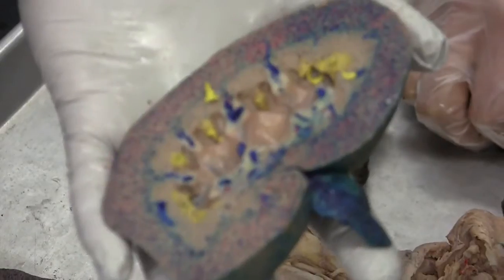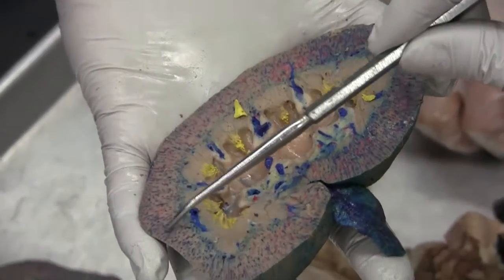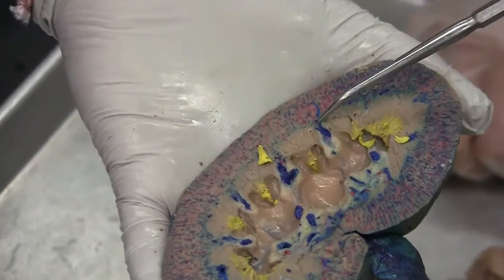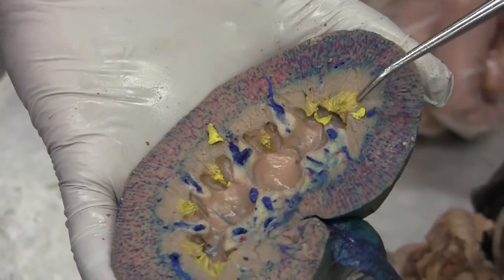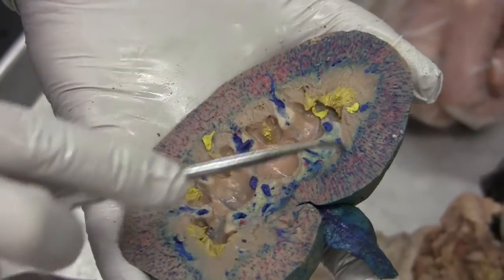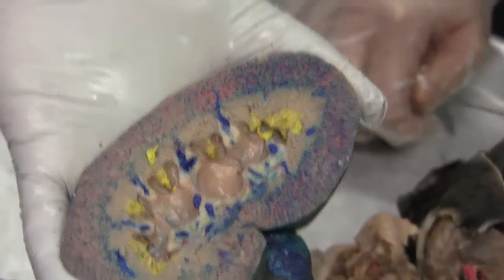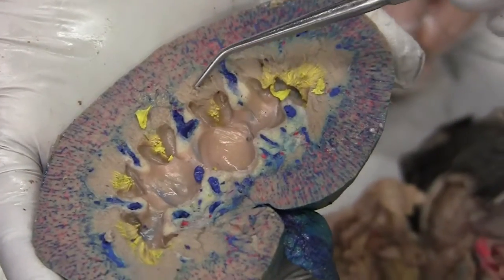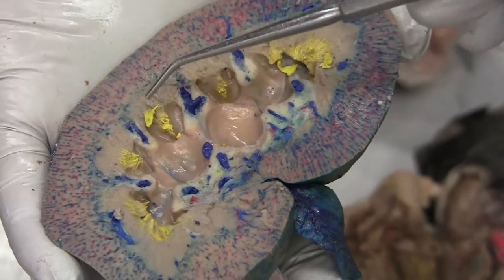The renal cortex. This is the renal cortex. The renal medulla — this inside portion. The renal medulla is the pyramids all together. That's the next one — the medullary pyramid. This is one pyramid, this is another pyramid, another pyramid, another pyramid.